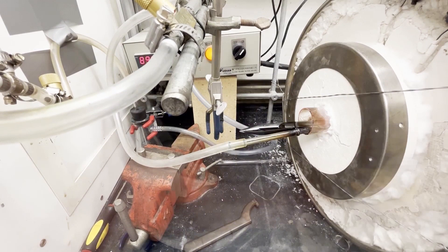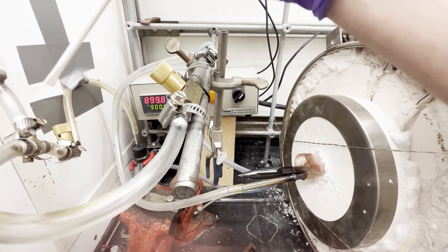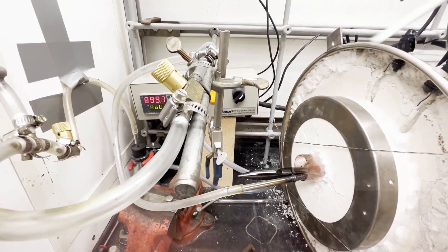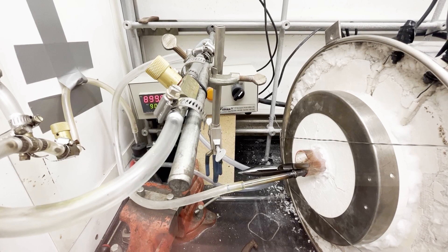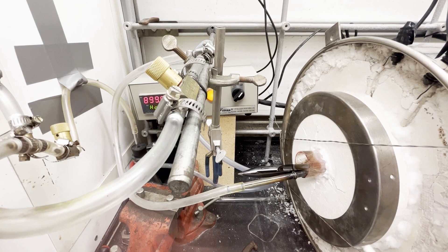It's connected also to the nitrogen line as well as the inlet for our tube. Really all you're doing is maintaining some constant vapor pressure of acetone so that your acetone will travel into your tube, get heated up in the furnace, and you'll get a nice good even coat all over the interior of your tube as you have it in this constant heat setup.